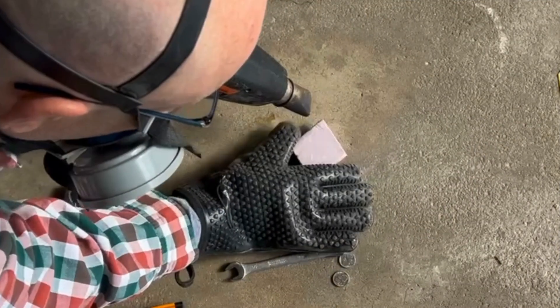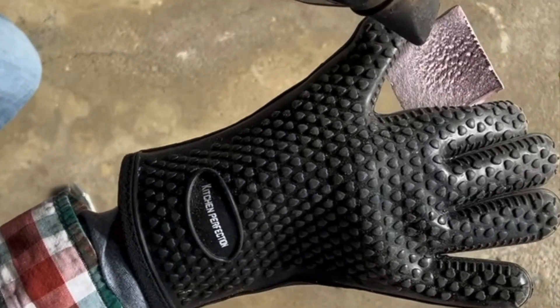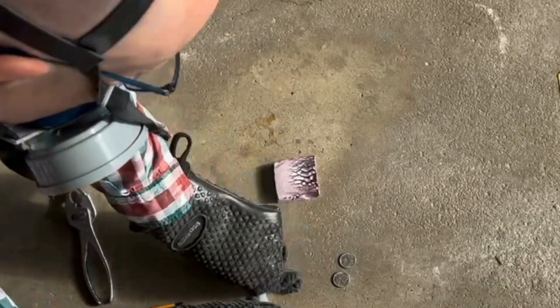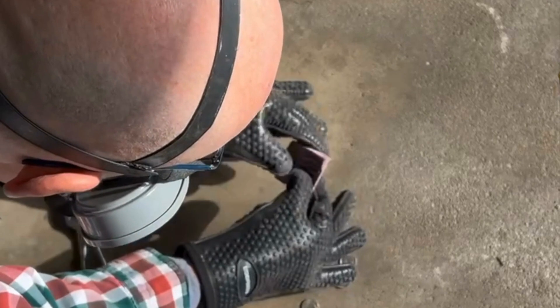This piece of insulating foam also undergoes a color change, but this one blackens — similar to burning and cooking — and I can't get this one to form into a new shape. Pretty sure this is a thermoset.